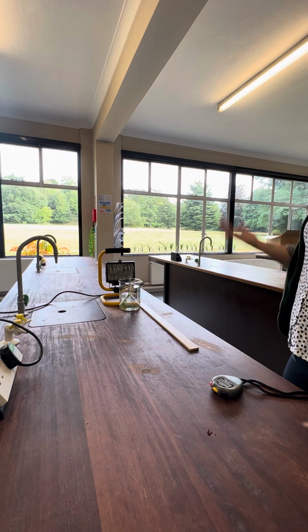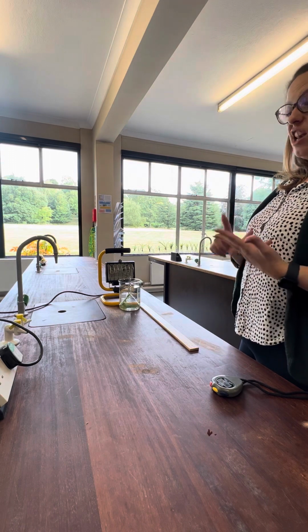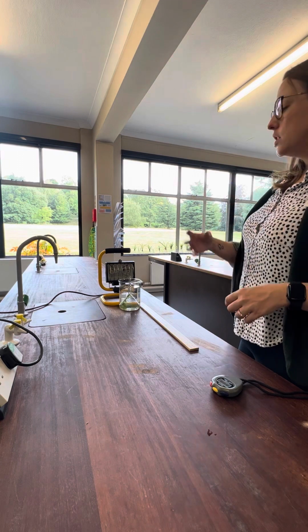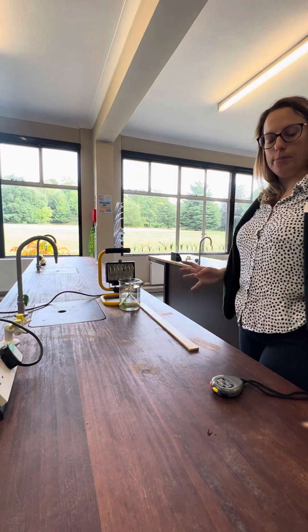From your knowledge of photosynthesis, you should know that you need carbon dioxide and water and light for photosynthesis to happen, and you get glucose and oxygen at the end. So we're going to be measuring the volume of oxygen produced by counting the number of bubbles in here, in a set time period.